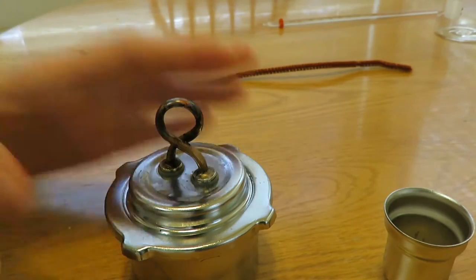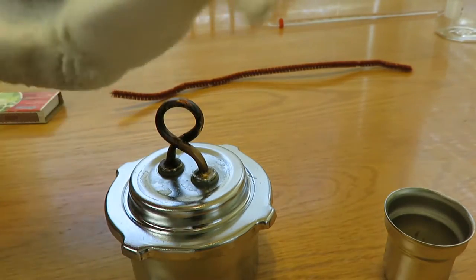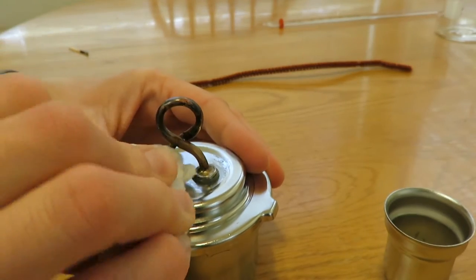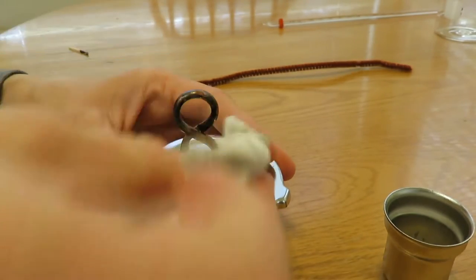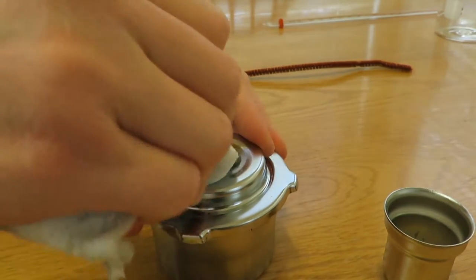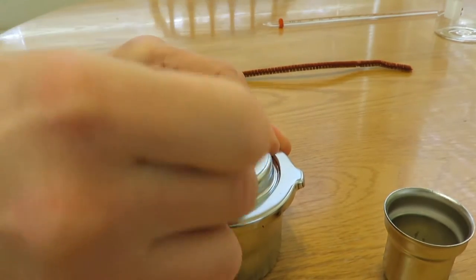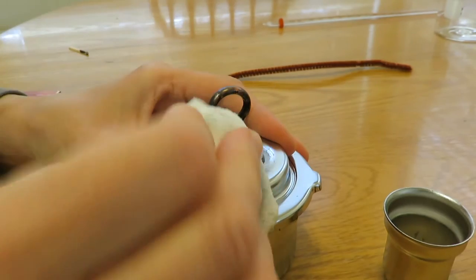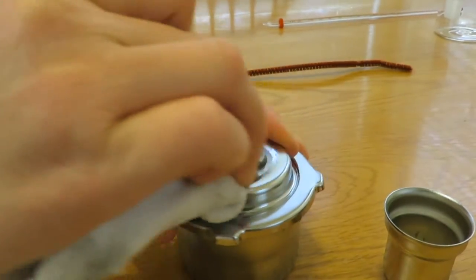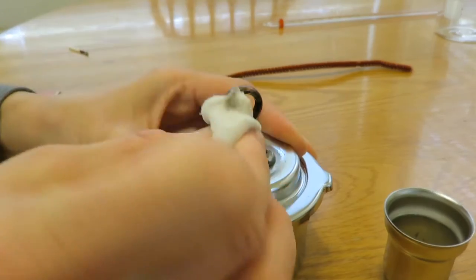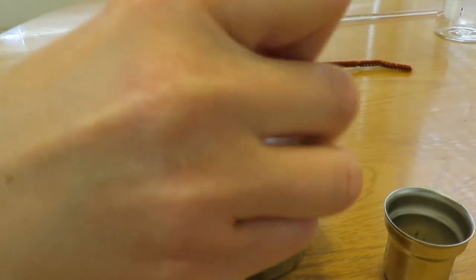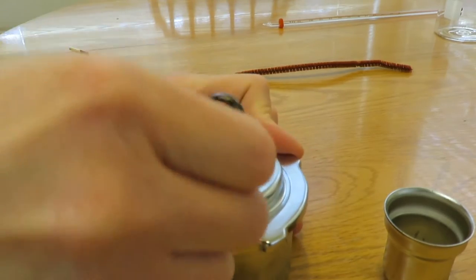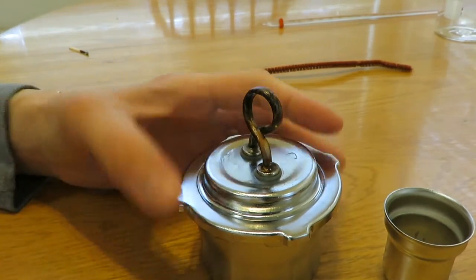I'm really torturing this poor magic eraser - it looks pretty shoddy at this point. I'm going to take this off and see what they're referring to underneath. Yeah, that's getting some stuff off.